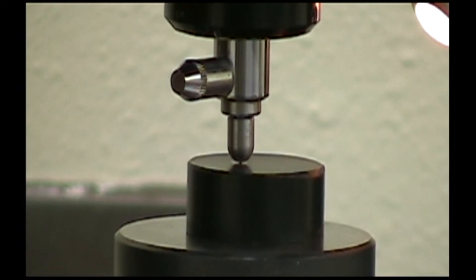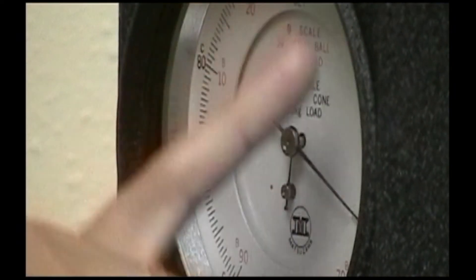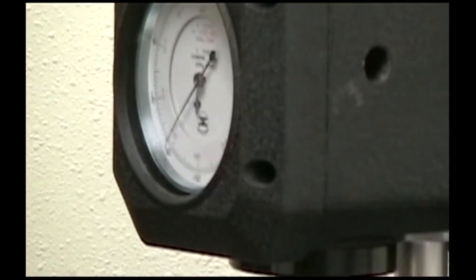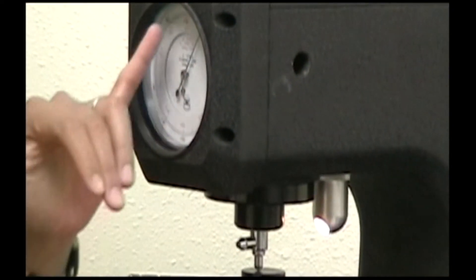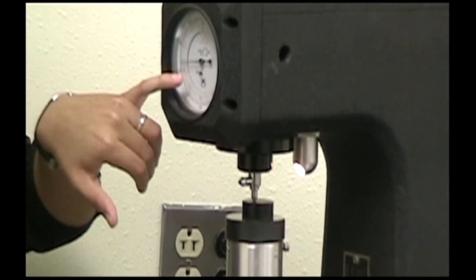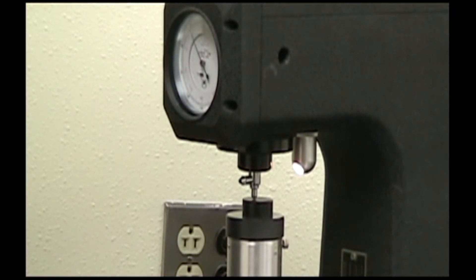Once it comes into contact, you'll see this needle start moving on this dial. And you want to continue raising your sample until the larger dial goes around three times, and the smaller dial on the inside points at the red dot in the center of the dial.